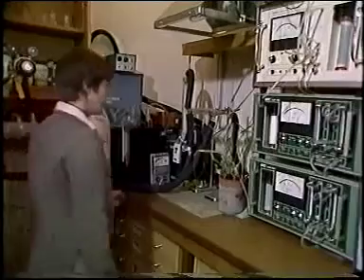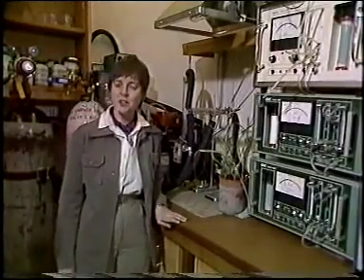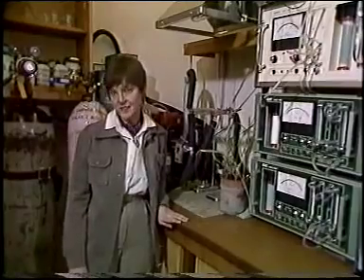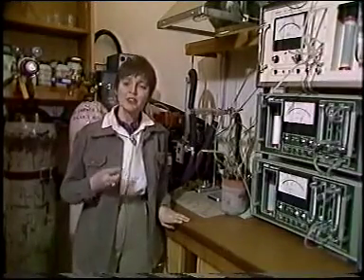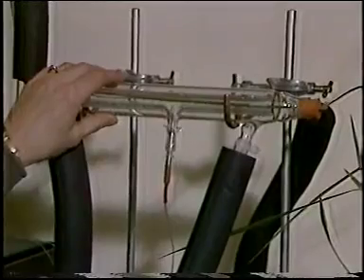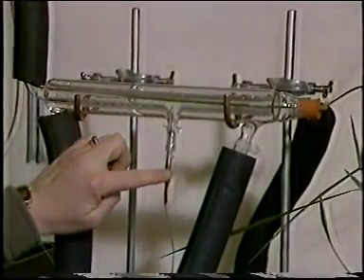In practice, it's a bit more difficult than this because the stomatal pores on the leaf surface through which the CO2 gets into the leaf are also sensitive to the factors we've been looking at: temperature, light intensity and CO2 level. But you've therefore got to control these factors. Well, now here, the jacket round the leaf chamber controls the leaf temperature, and this thermocouple actually monitors the temperature at the surface of the leaf.